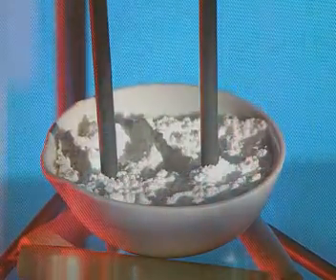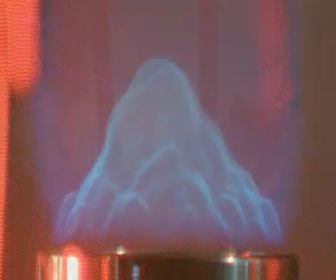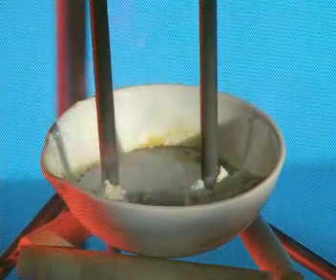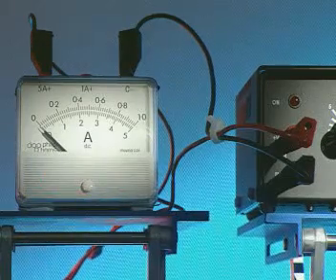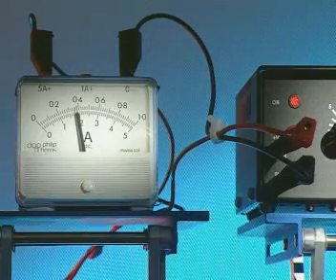Lead bromide melts at 370 degrees Celsius. Switch on now and a current flows.